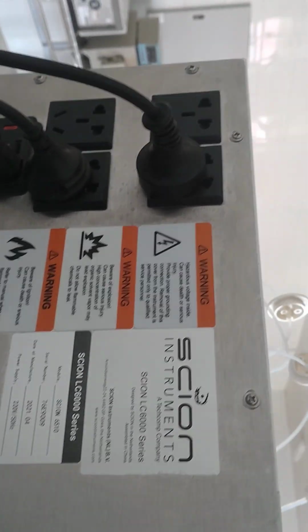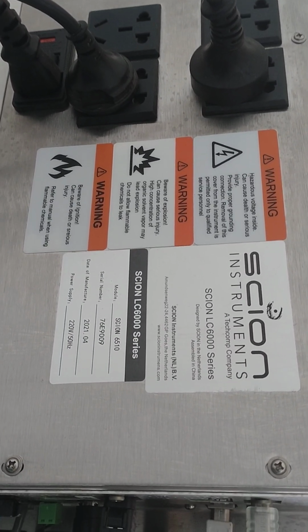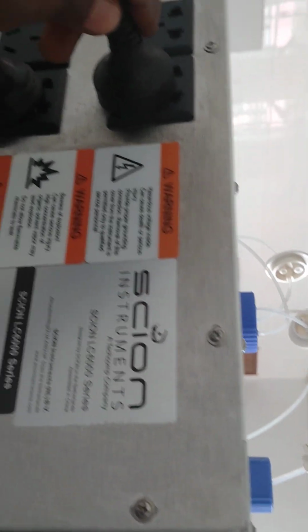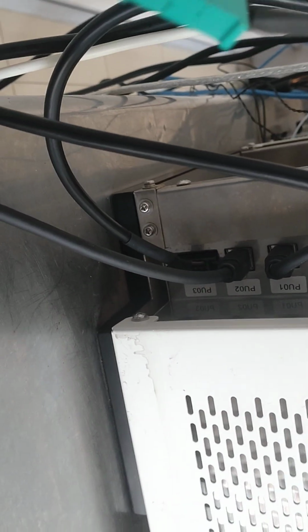And apart from the other components that are connected to this organizer, we can list, for example, the column. This is the column that is connected. This is the column. You can check. This is the cable power for the column. And for the pump, there is no power cable. Only these cables are put, and one has to play the role of the power supply.